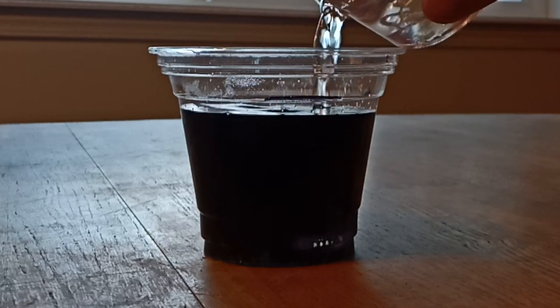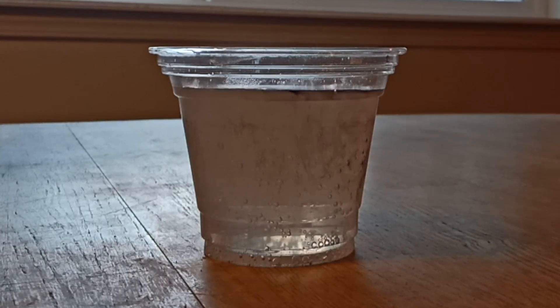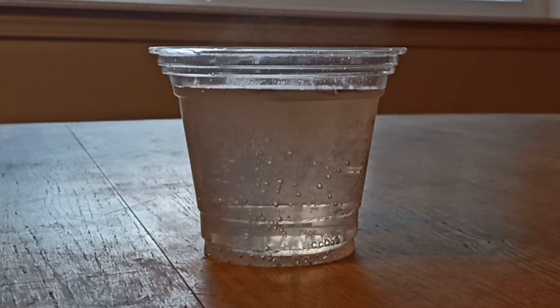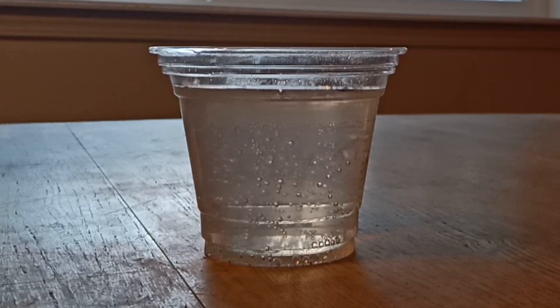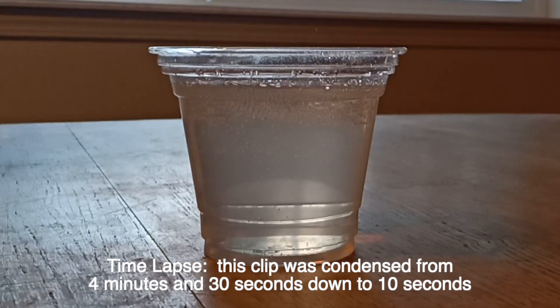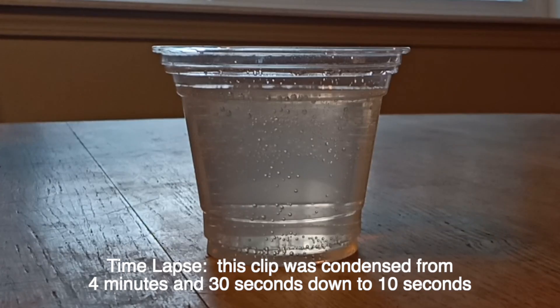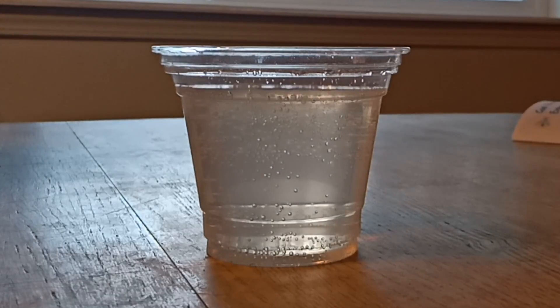In this demo we're pouring a sodium thiosulfate solution into our oscillating reaction that ran out of energy and was stained purple. We're going to see what happens — it should be a reverse clock reaction. Pouring that sodium thiosulfate in made the purple color disappear, and then it's going to take about four and a half minutes and we should see a clock reaction happen.